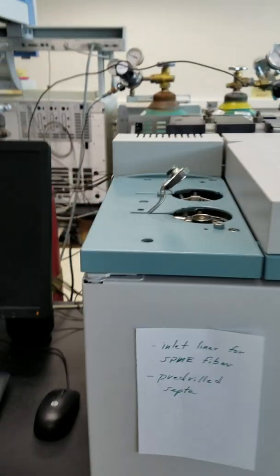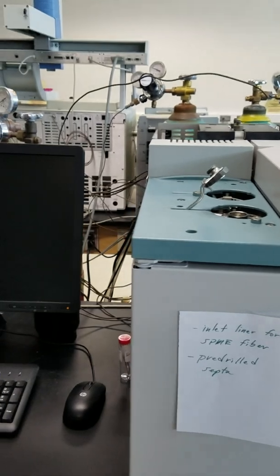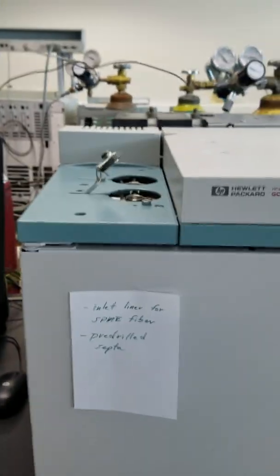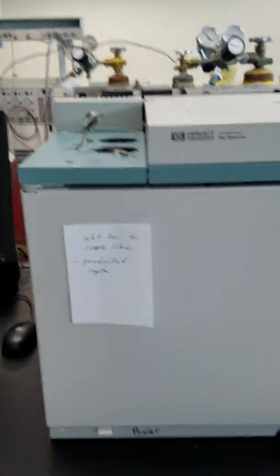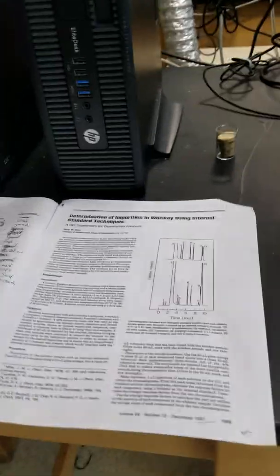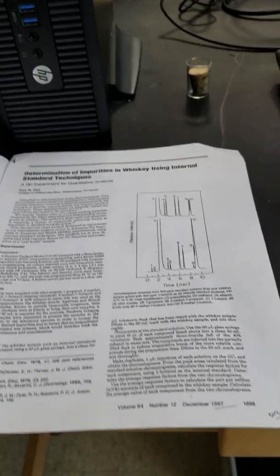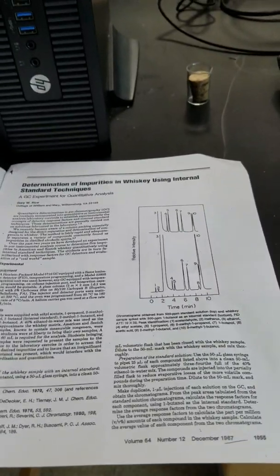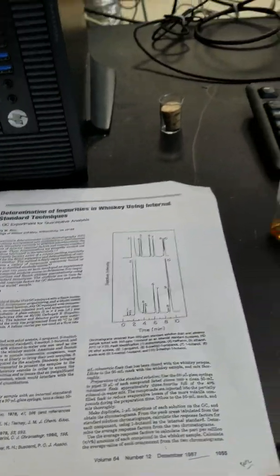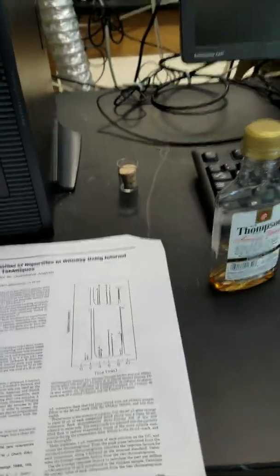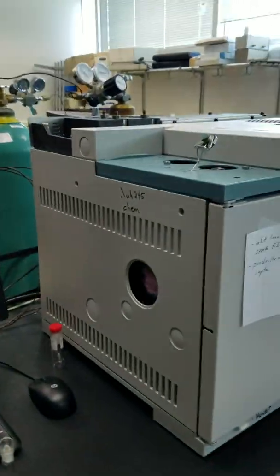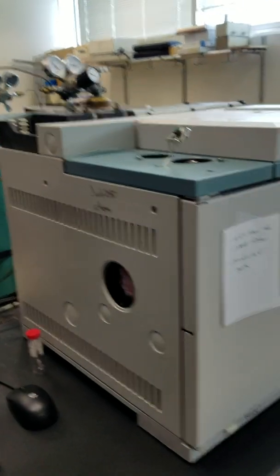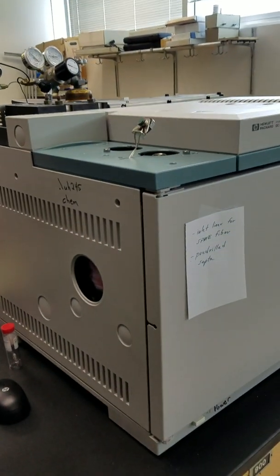The cap comes down. I'll put the injector back together. You'll get the chromatograms in the Excel sheet and the paper that describes exactly how the analysis was done. This will be our last lab of the semester. Thank you.